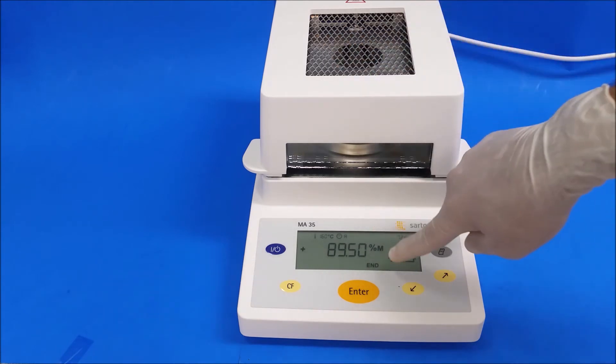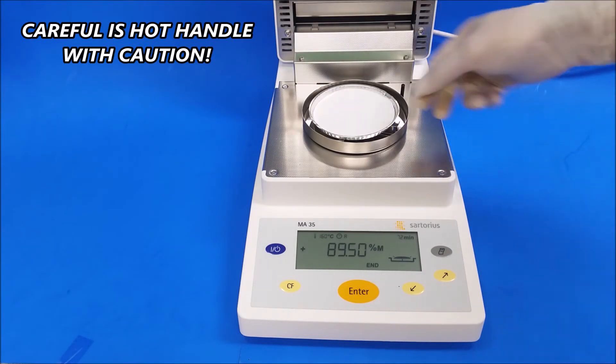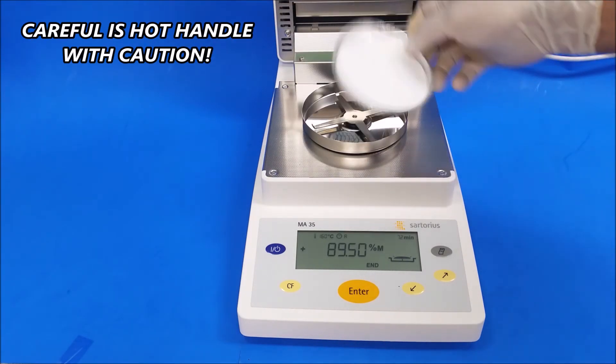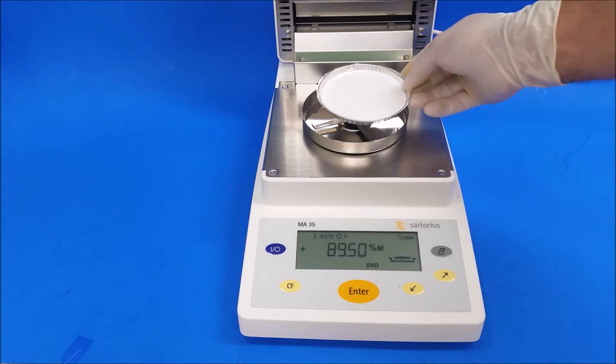The result will say 'end,' that's when you know it's finished, and it shows the time it took. Don't use these pads again, they're trash. Just get rid of them and always start with a new fresh one.